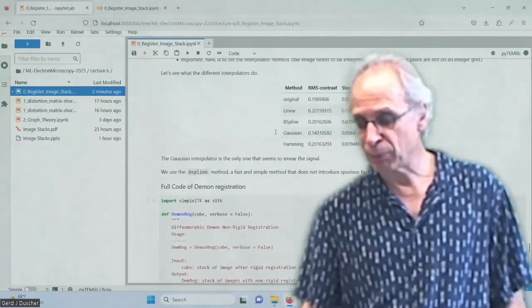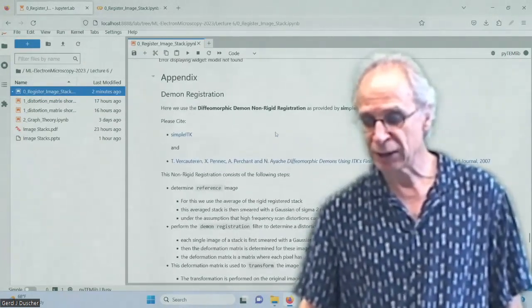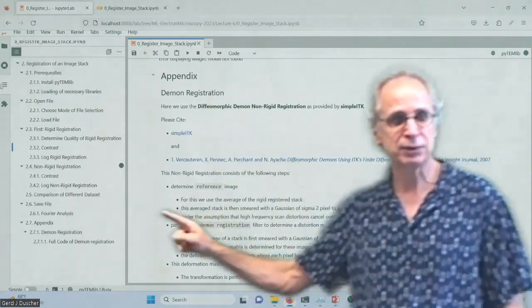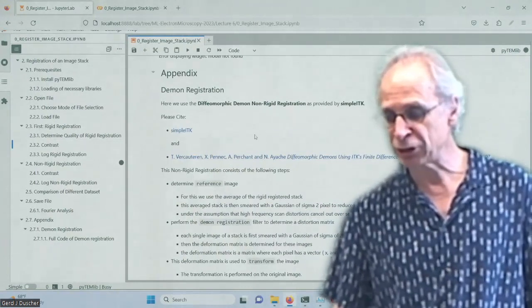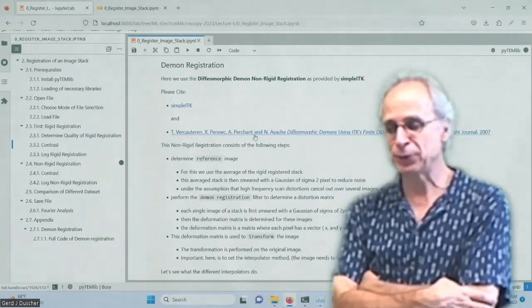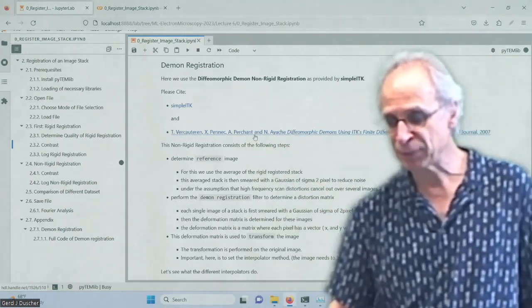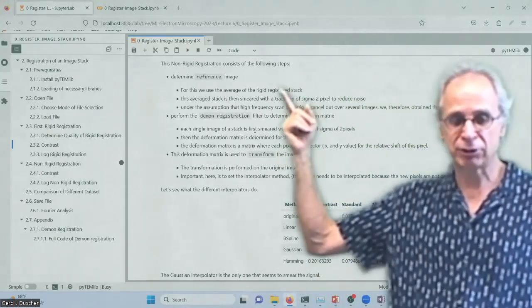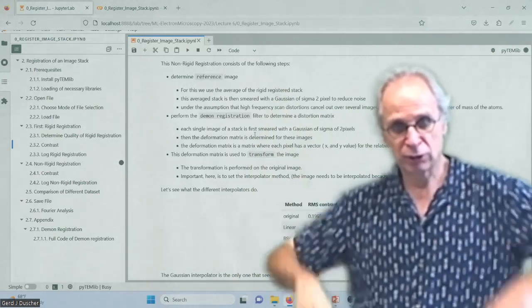There are different functions that you can use with this demon registration. So here, if you go to the appendix, while doing that, we can go through that a little bit. So we do a demon registration. It's called diffeomorphic demon non-rigid registration, if you want to be super precise, by simple ITK. And so here are the relevant links for that. So we do the reference image. And in our case, the reference image is the registered stack summed over all the images.